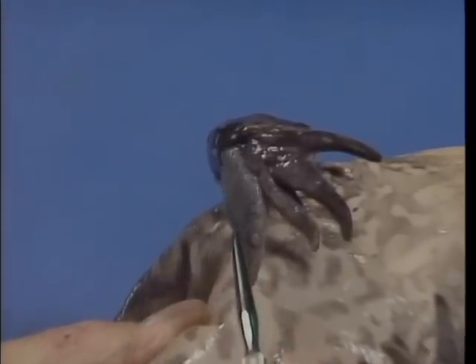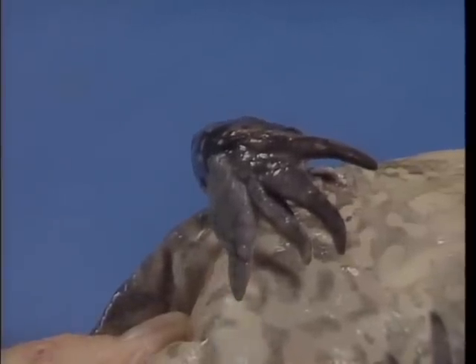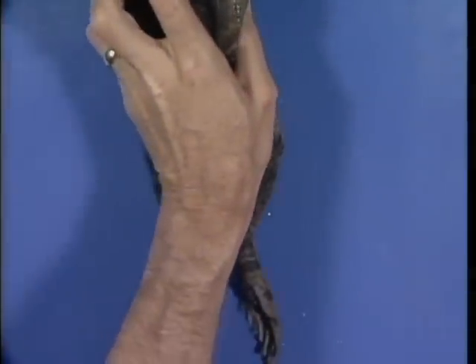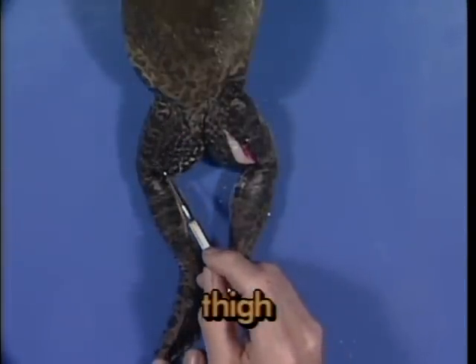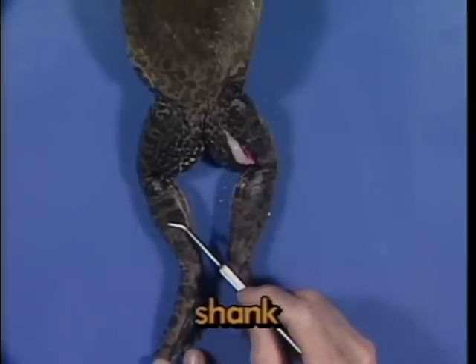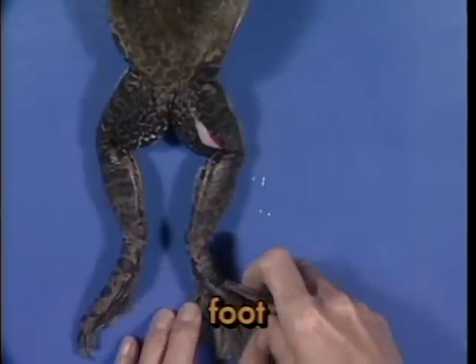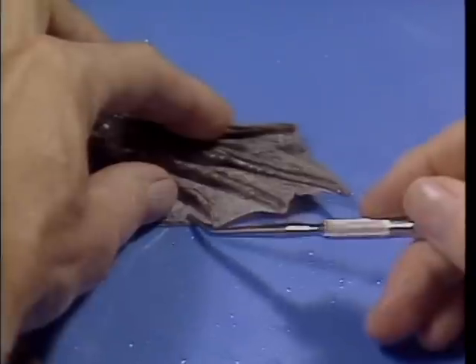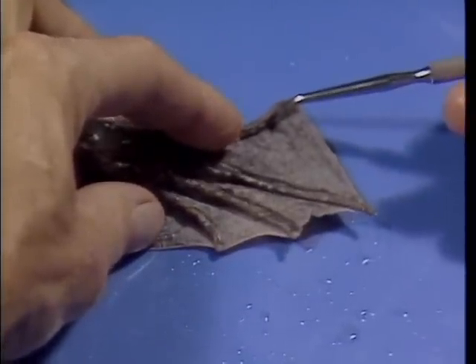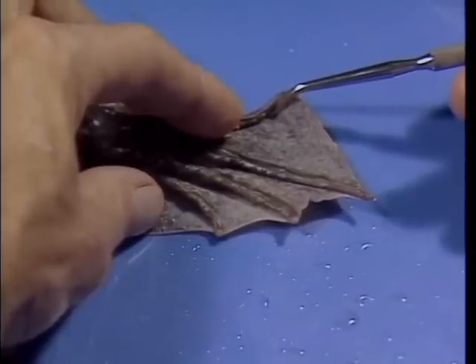If your specimen is an adult male, you may be able to locate an enlarged, darkened thumb pad, which is used to hold tightly to the female during reproduction. The hind limbs are much longer and more powerful than the front ones. Each hind limb consists of an upper portion, the thigh, followed by a lower shank, an ankle, and a foot. Notice here that the hind feet have 5 toes each, and a thin membrane of skin extending between each toe to create webbed feet. The powerful hind limbs and webbed feet are ideally suited for swimming in the water as well as for hopping on land.